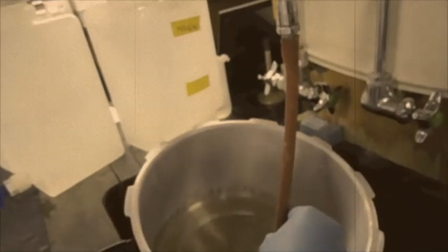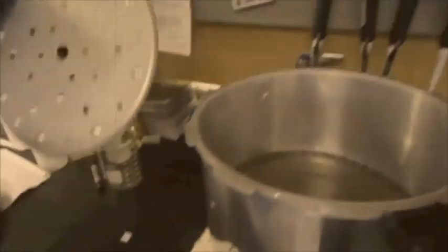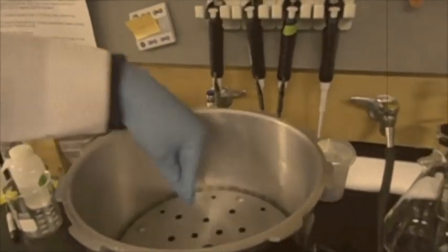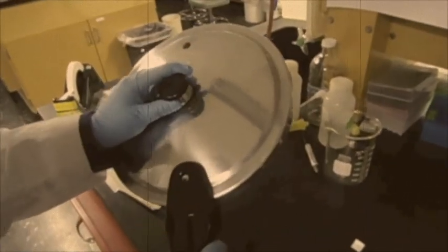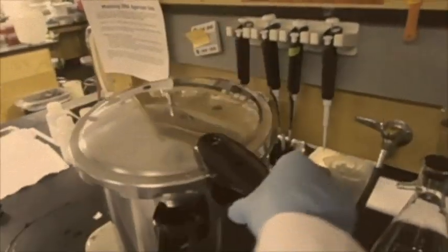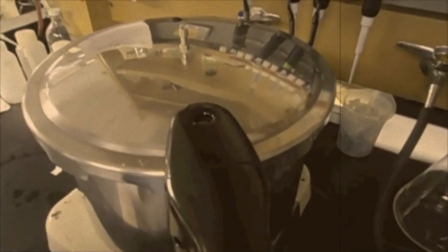Add a small amount of water to the pressure cooker's body. Next, insert the cooking rack and then your beaker. Make sure that the vent pipe is clear. Close the pressure cooker and set the timer to 30 minutes.